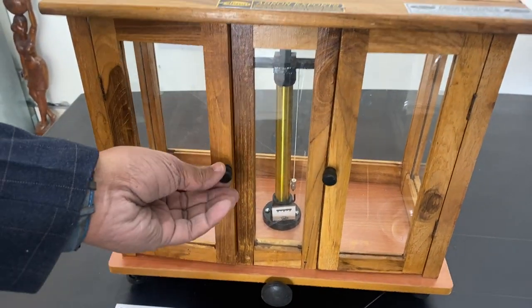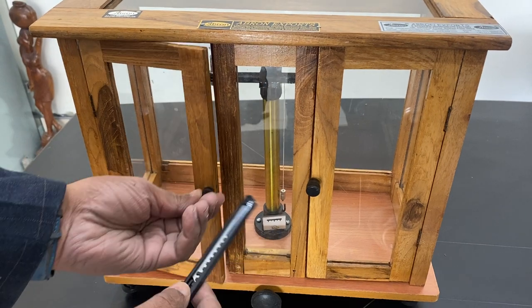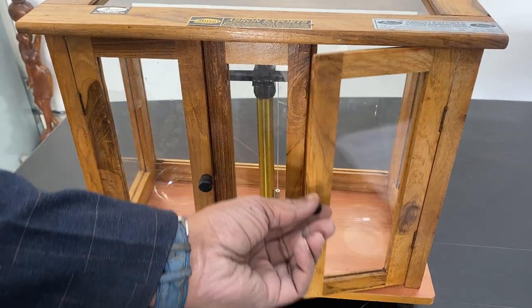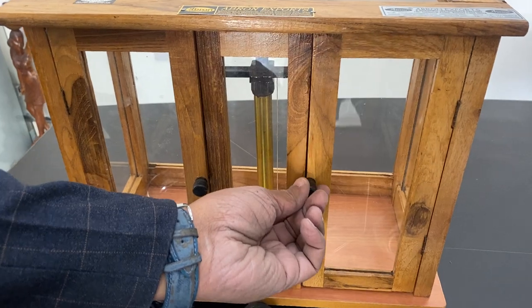Here you can open the box. There is a lock here that you can use for teaching how the balance works.